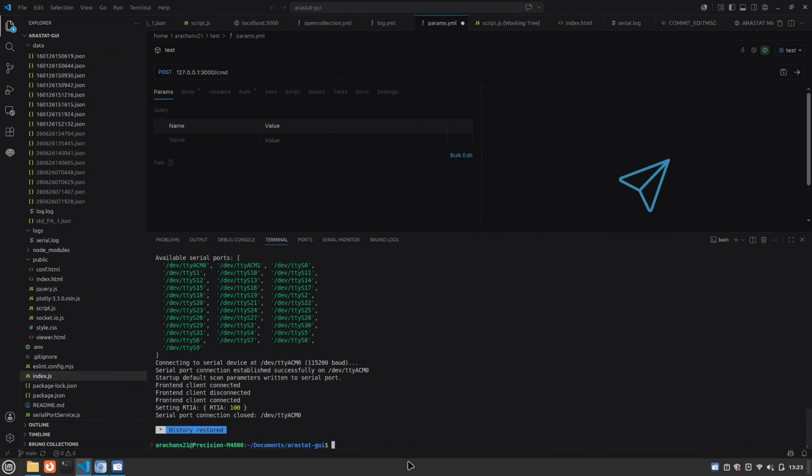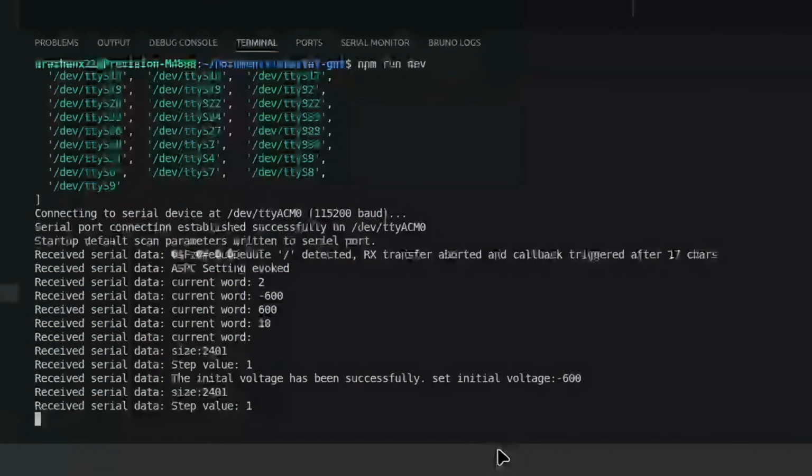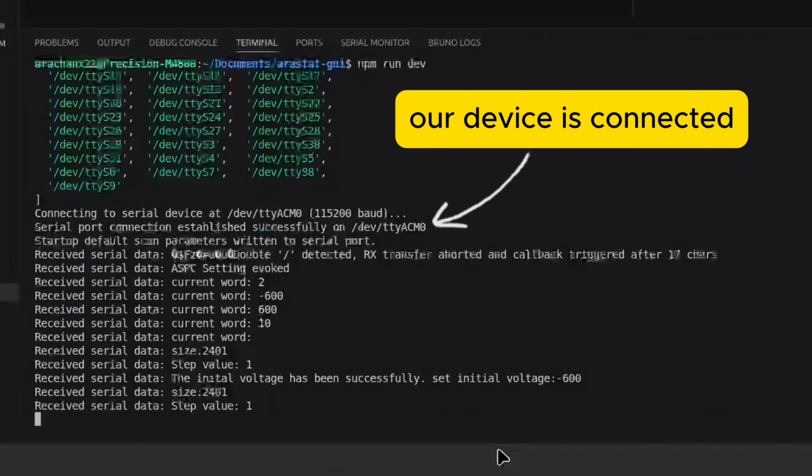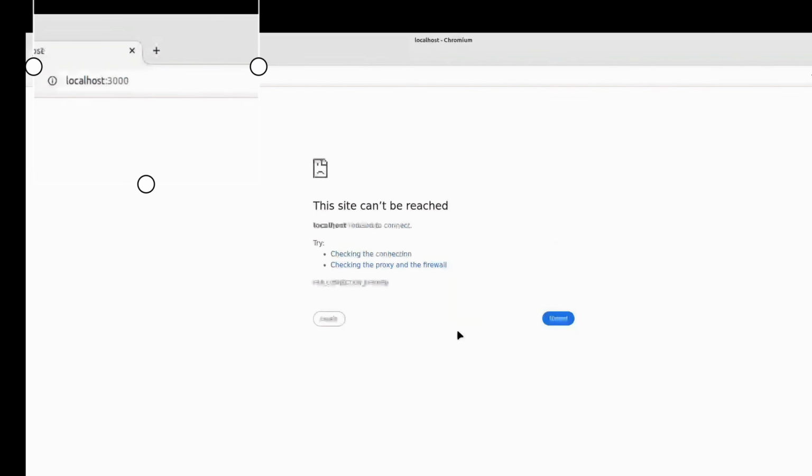So this is how we run the web app. First, we run the code. Make sure that you have connected the microcontroller to the PC so that the web app recognizes it. After this, we can go to our local web page. In this case, we use port 3000.